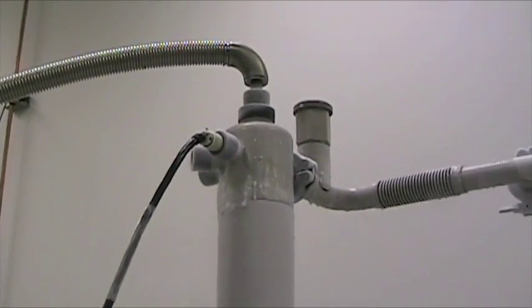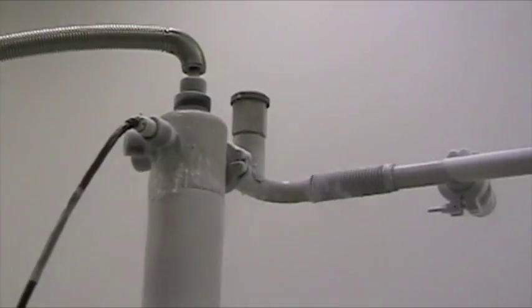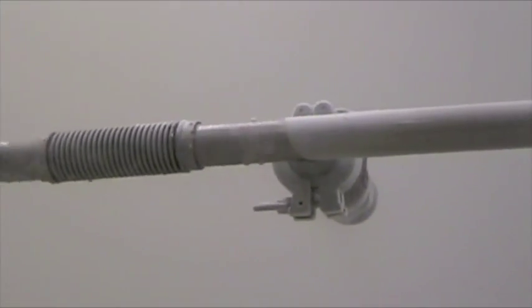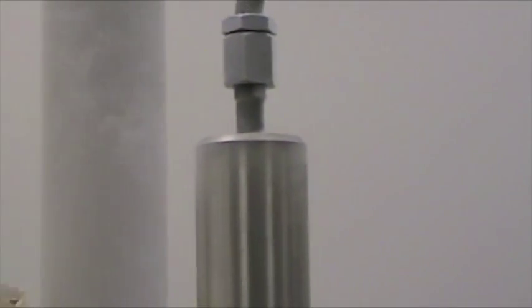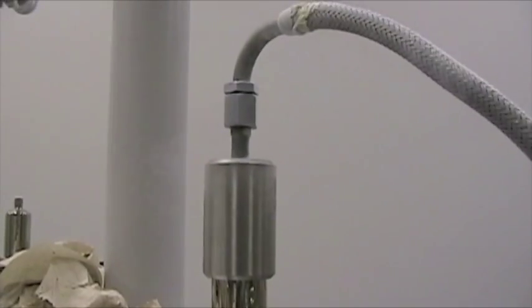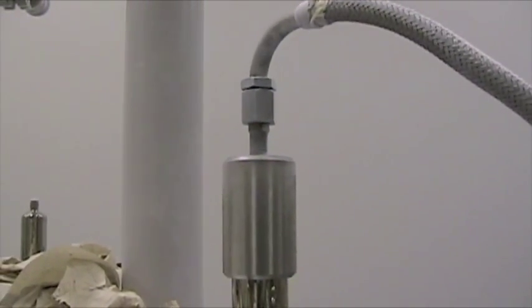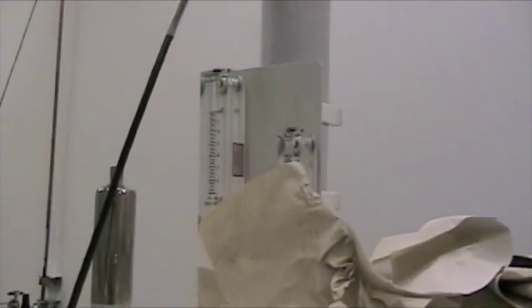So going in there is liquid helium. Coming out there is the gas helium. Coming out there is the gas nitrogen. And going in here is the liquid nitrogen.